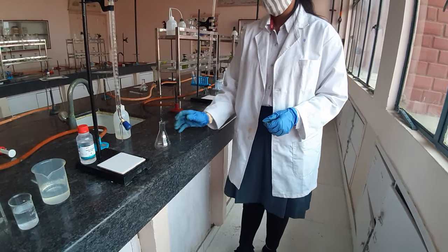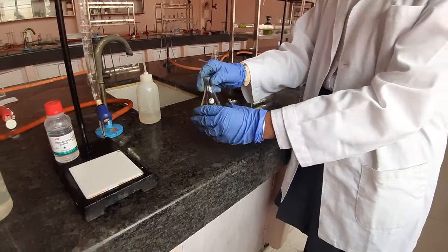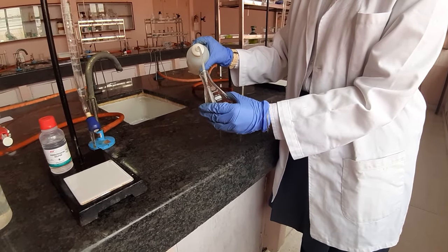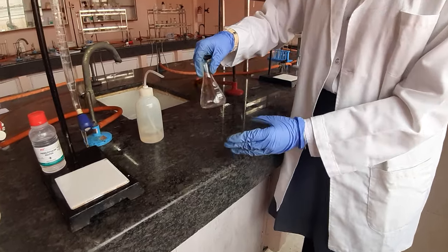The second apparatus is the titration flask. This needs to only be washed with water — add some water to it, swirl it, and then discard it into the sink.